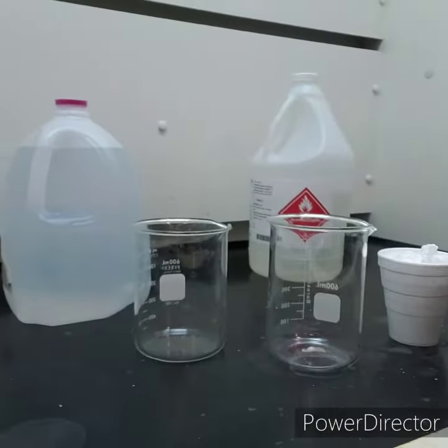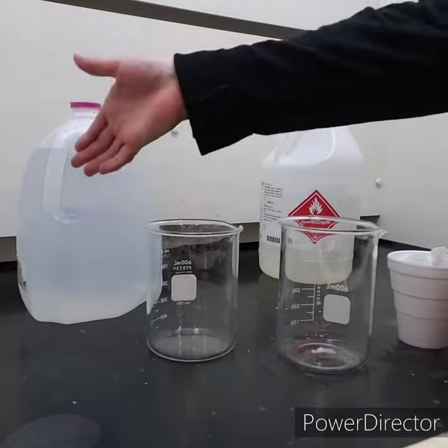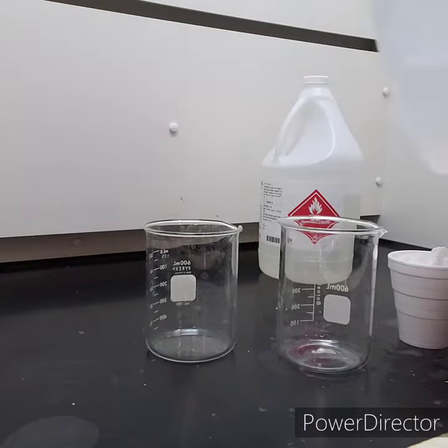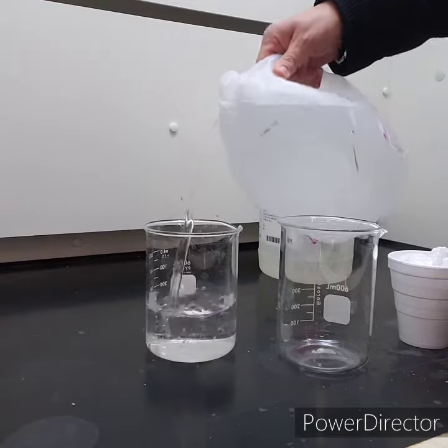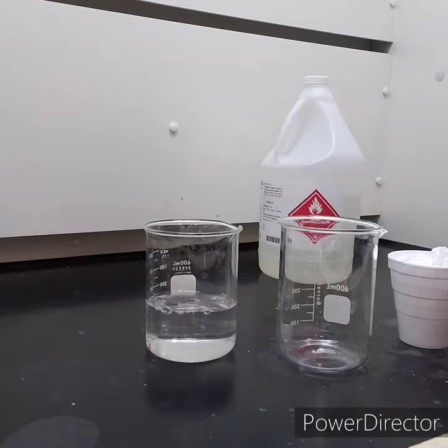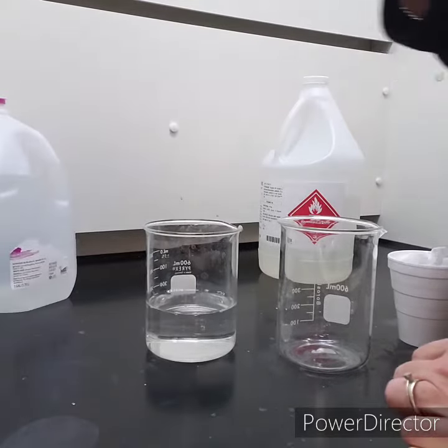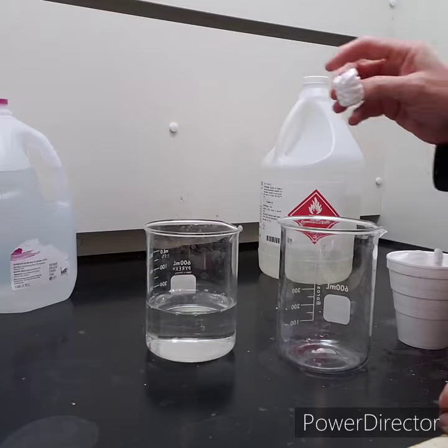Hello, working in the fume hood again for a polarity demonstration. Here we have just regular old distilled water. Water is polar, so only polar things are going to dissolve in water.